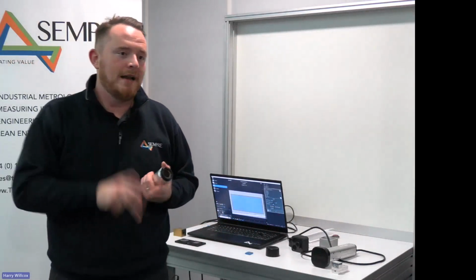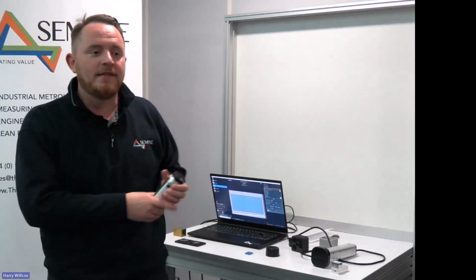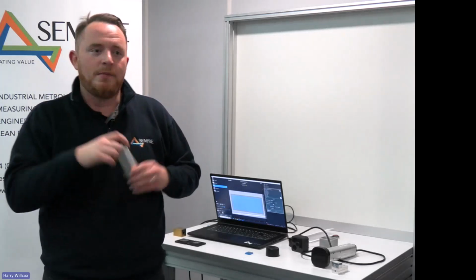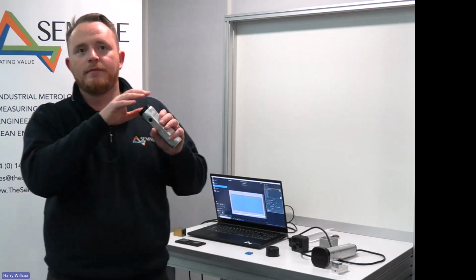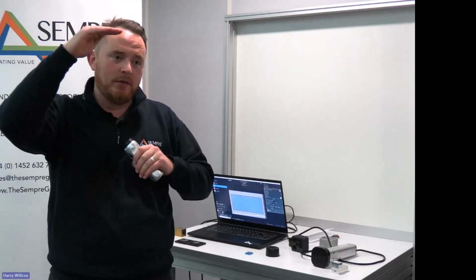So that would be laptop, training, installation, the system itself, Peli case, so effectively the package. There's a little bit of variance in that, depending on the system type that you go for. So they have higher X and Y resolution calibration artifact, which is a slightly higher cost, and that goes all the way up to sort of 40k ballpark, depending on the software level.